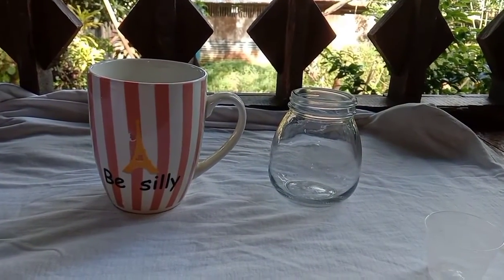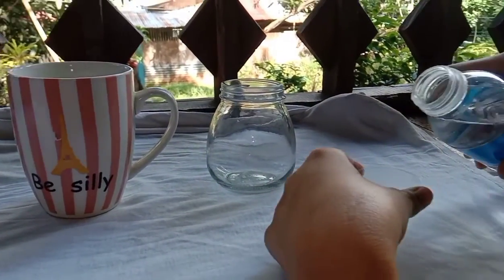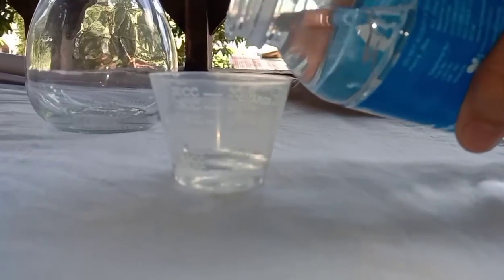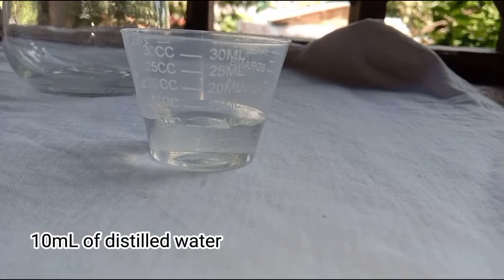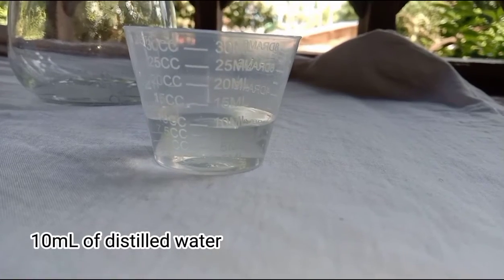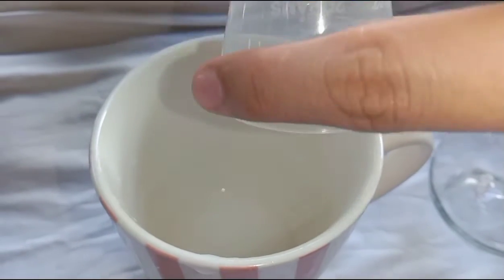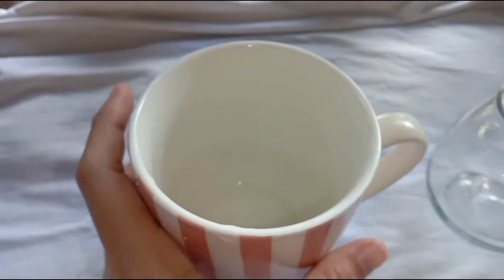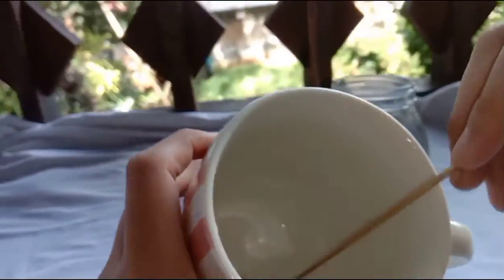And add 10 ml of distilled water. Add it on a 25 ml cup. And stir.